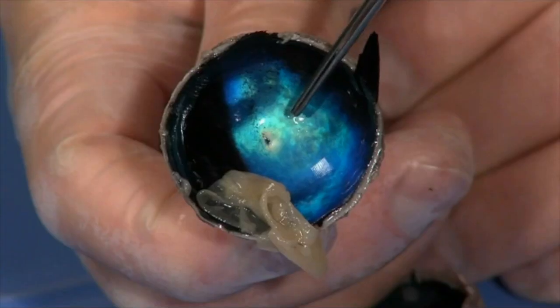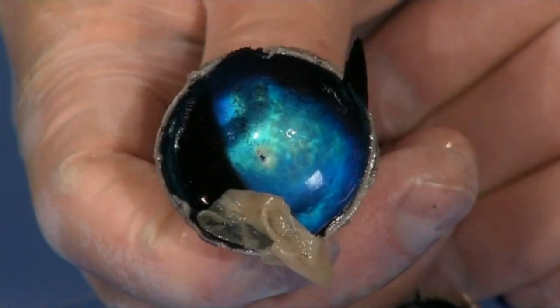We often say cats can see in the dark. Well, they can't see in literal darkness, but they can see much better in low light situations, as can cows. It's also what's responsible for that eye shine if you shine a flashlight in the eyes of an animal. You see that reflection. It's reflecting off of this bright tapetum lucidum layer in the back of the eye.